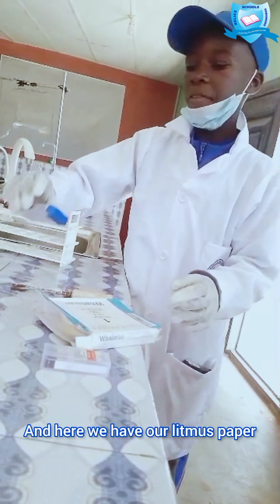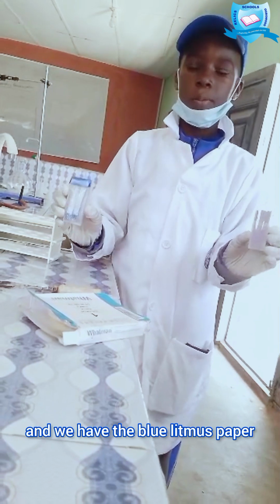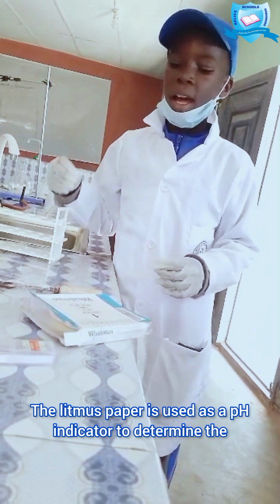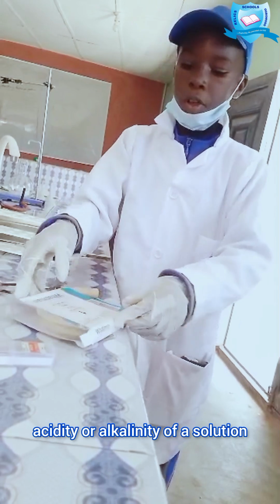And here we have our litmus paper. We have the red litmus paper and we have the blue litmus paper. The litmus paper is used as a pH indicator to determine the acidity or alkalinity of a solution.